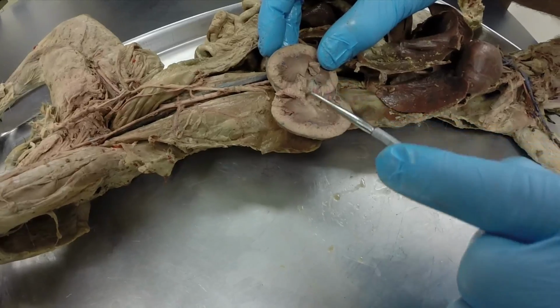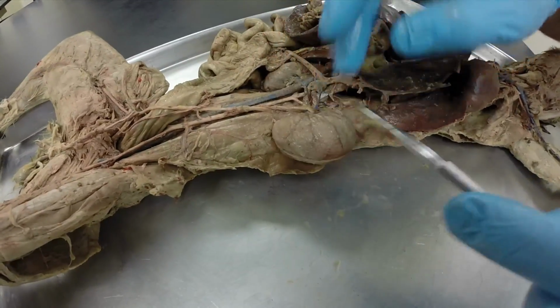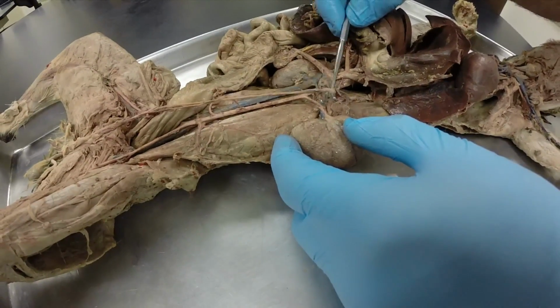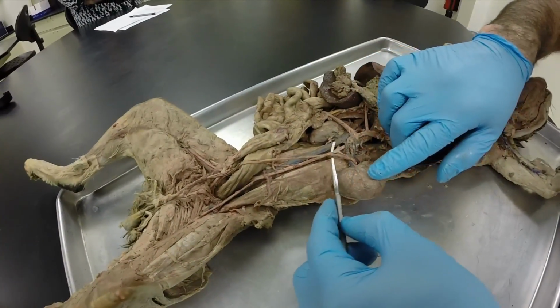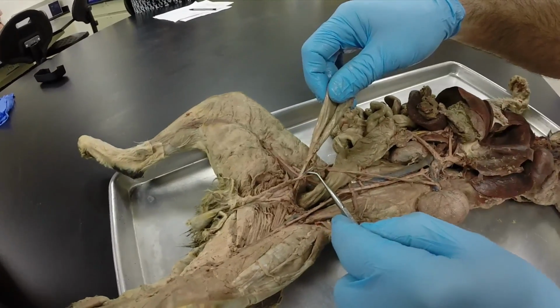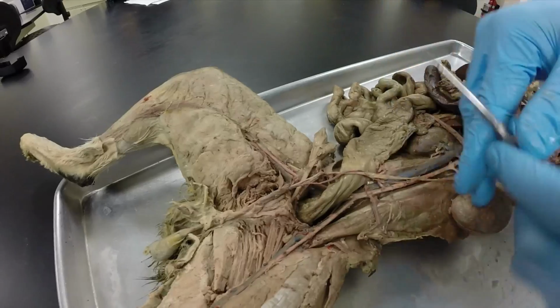Just an open area, and the renal pelvis is basically collecting all this material and then sending it down this. It's urine at this point. This is called your ureter, and this would be a left ureter. Right. So the ureter is draining urine from the kidney to the urinary bladder over here. And then we have the urethra, which is now draining the urinary bladder to the outside world.